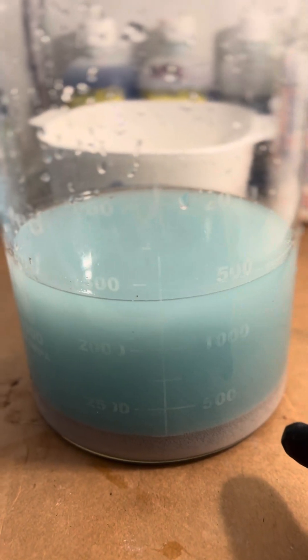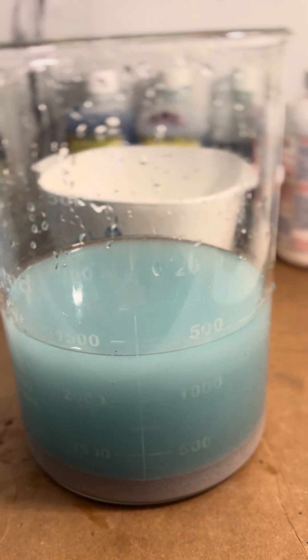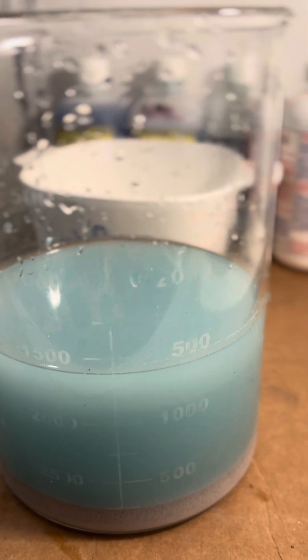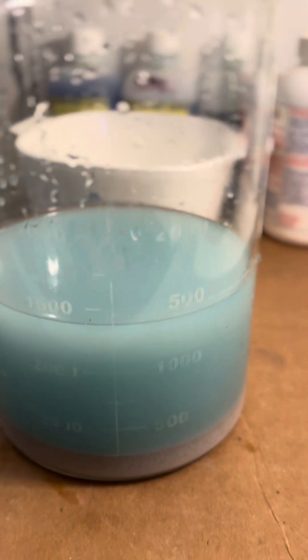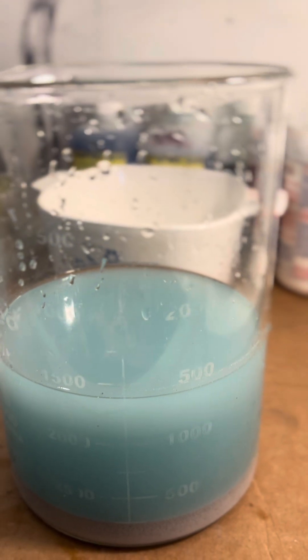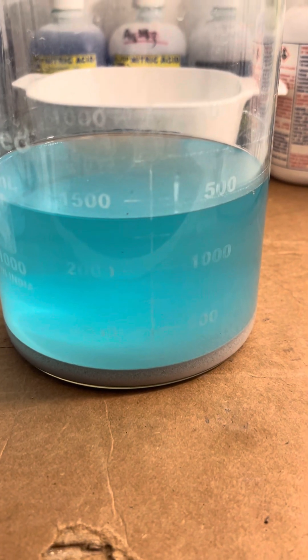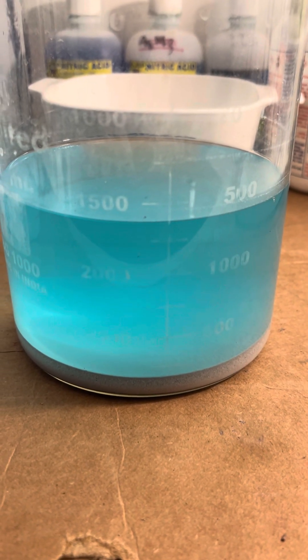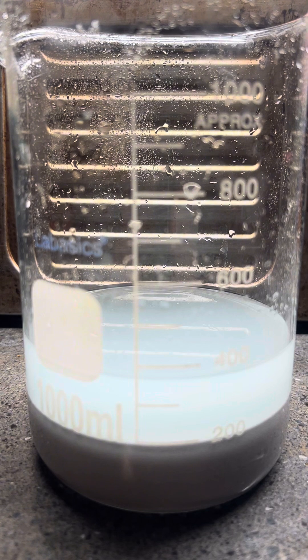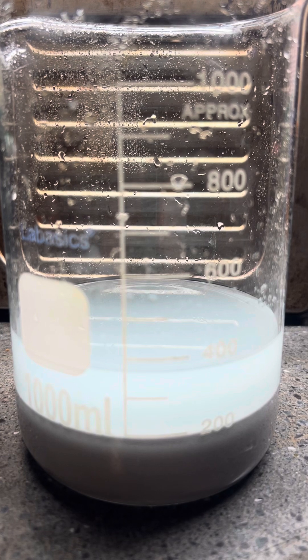We've got the silver chloride in a different container. I'm going to let that settle down for a little while and then pour it off. Then I'm going to start with some hot water rinses and put it in a smaller container so the volume is a little smaller but leaves enough room so that we won't have any boil-overs with the lye or sugar method. We've rinsed it a couple of times and now putting some hot water on it, letting it settle and decanting to start cleaning up that silver chloride.